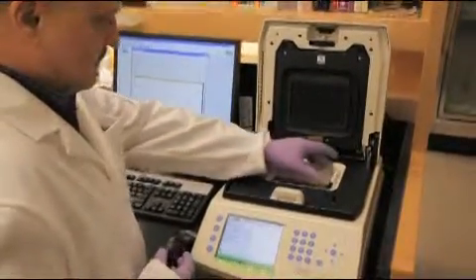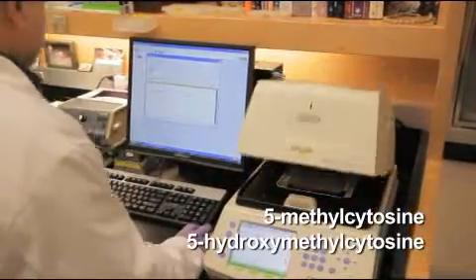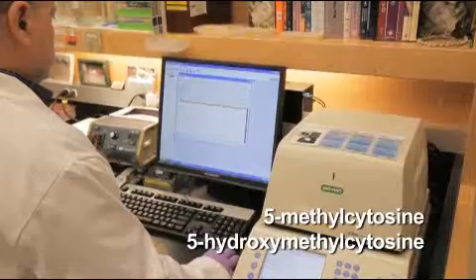Real-time PCR can also be performed to quantitate amounts of 5-methylcytosine and 5-hydroxymethylcytosine. Please refer to the product manual found on neb.com for specific information.